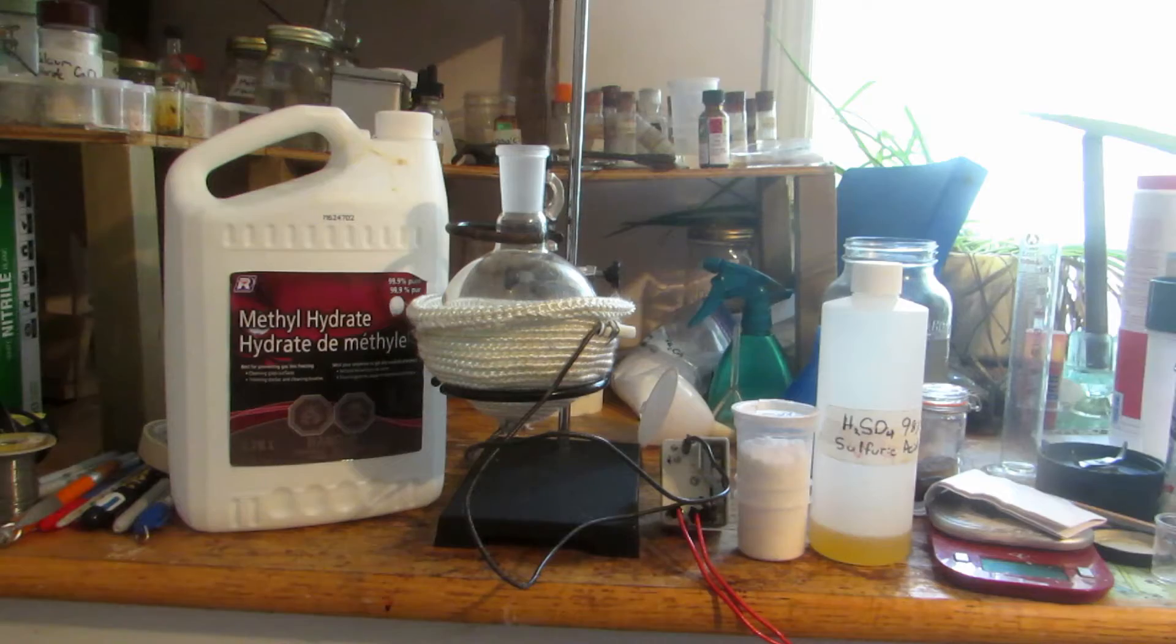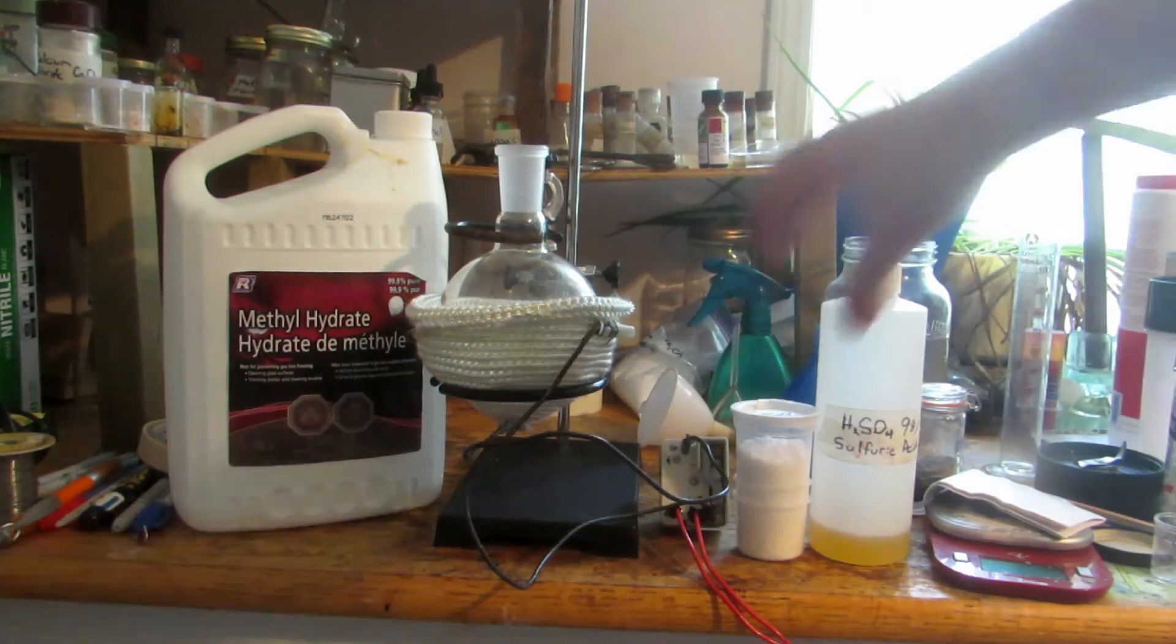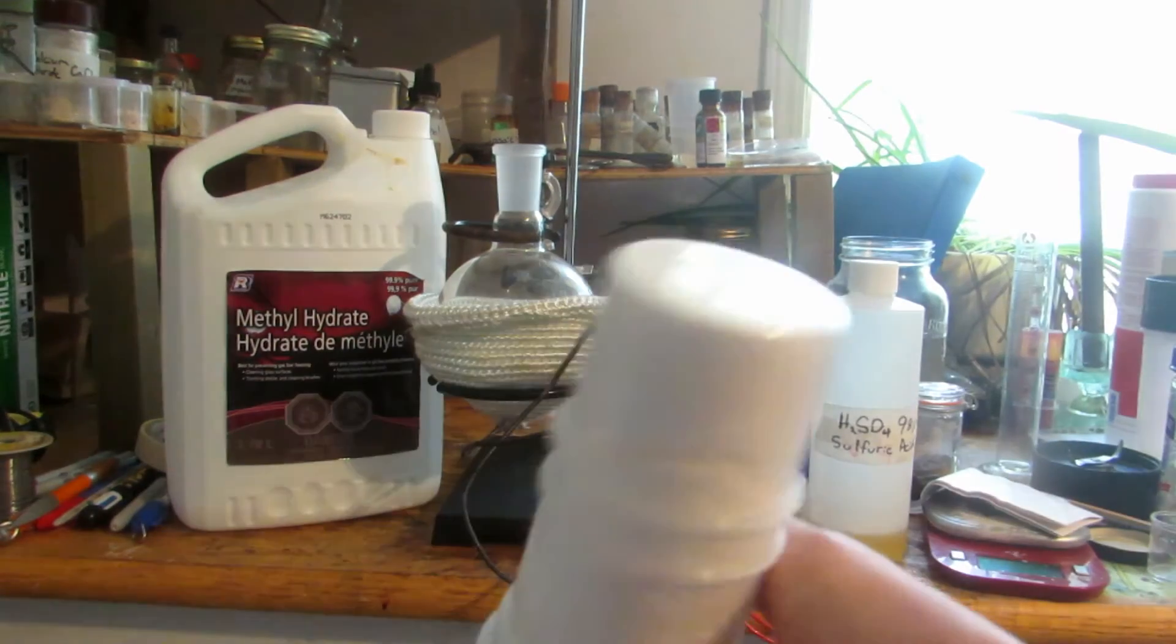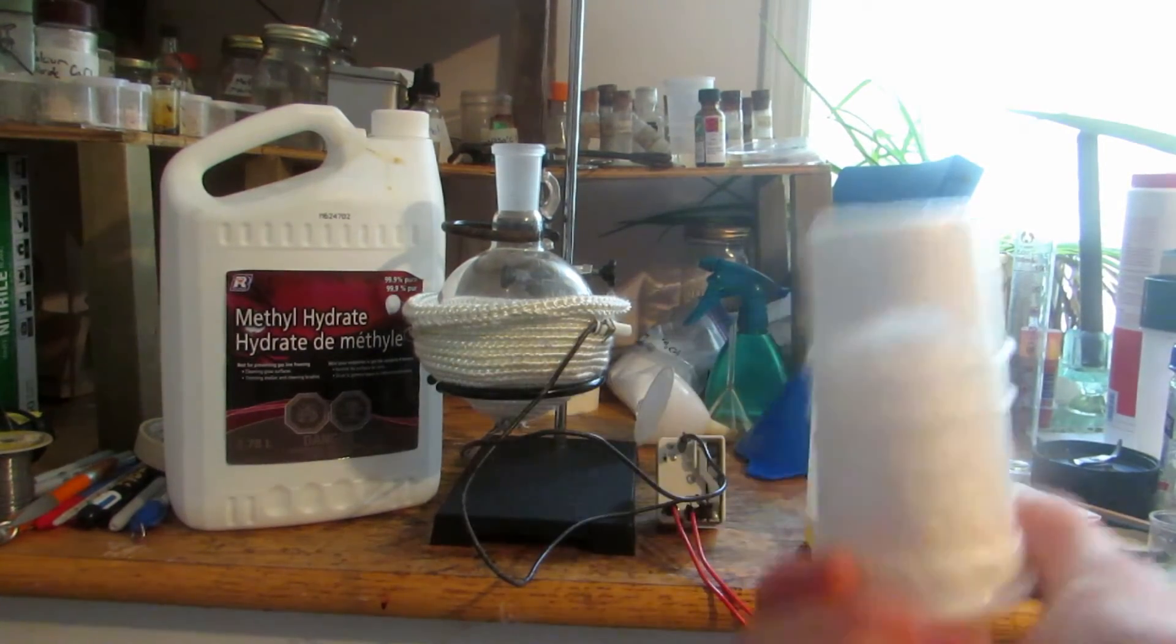Hey guys and welcome back to another video. In a previous video we made this salicylic acid through the hydrolysis of acetylsalicylic acid, which we extracted from aspirin.